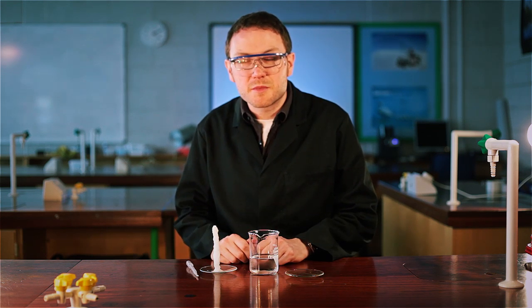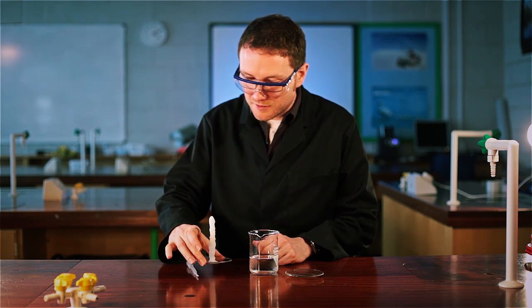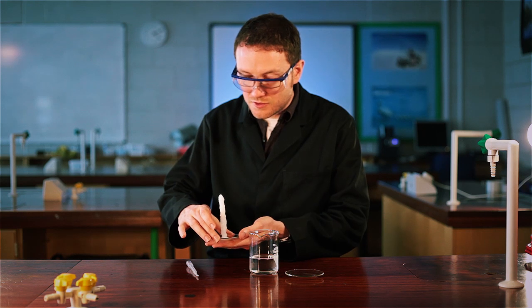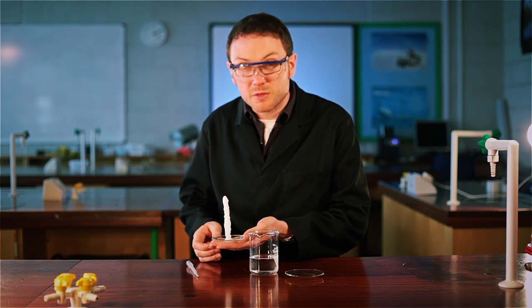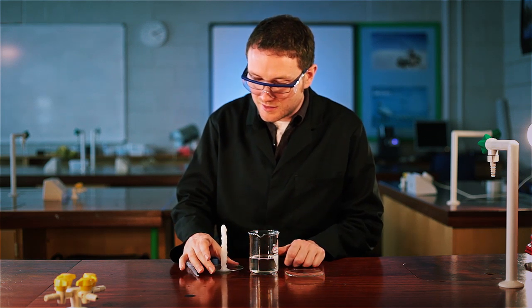There you go. So, supersaturated sodium acetate. Go ahead, form some stalagmites, and of course, make sure that you've got somebody nearby who can feel the bottom of the watch glass and confirm that, in fact, heat has been released in this process.